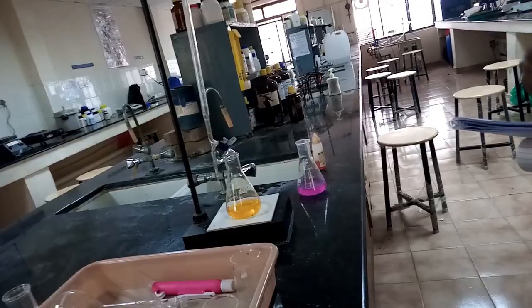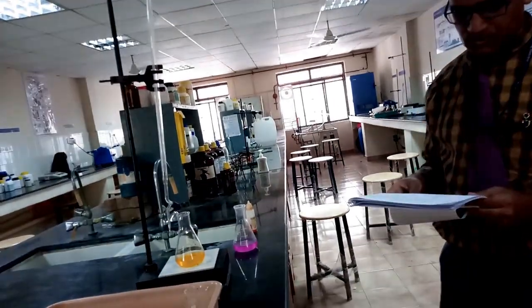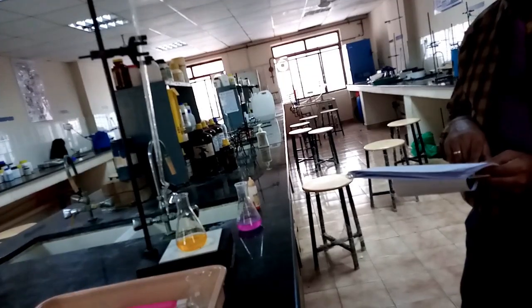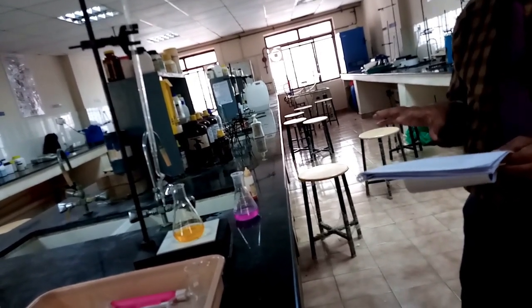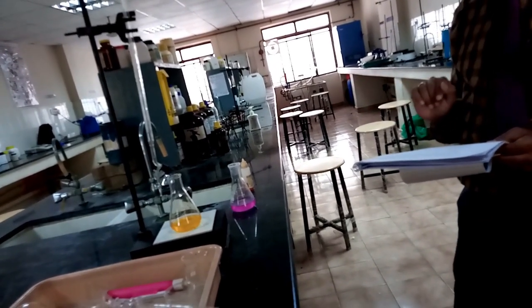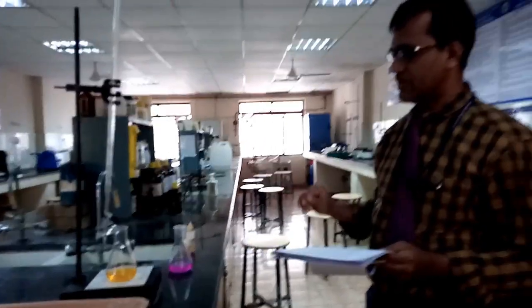Then you titrate against the respective opposite chemical reagent. For example, for alkalinity, you use the standard, freshly prepared HCl in the burette. In the calculation, you note down the volume of HCl run down, which is the observation, and the normality of HCl. Before conducting the experiment, you have to do the standardization using the respective opposite chemical reagent. You have to do the standardization for both alkalinity as well as acidity.